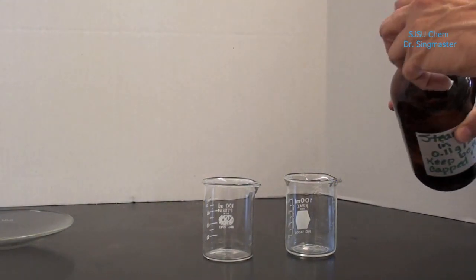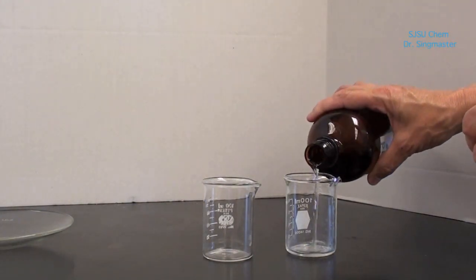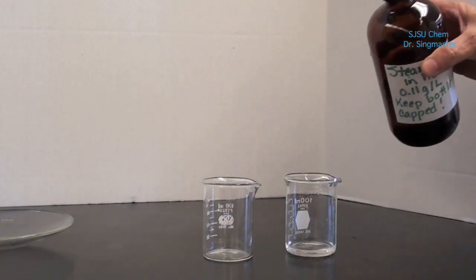The first thing we need to do is determine how many drops of stearic acid are in one milliliter of stearic acid.